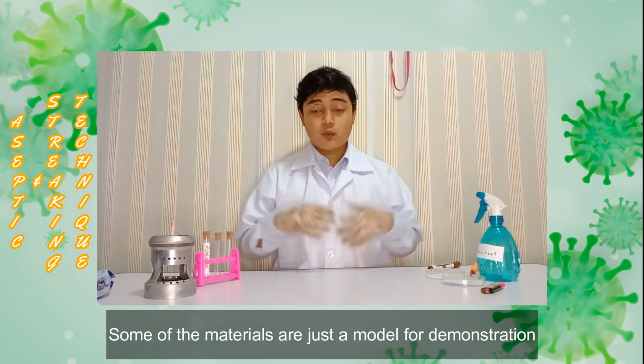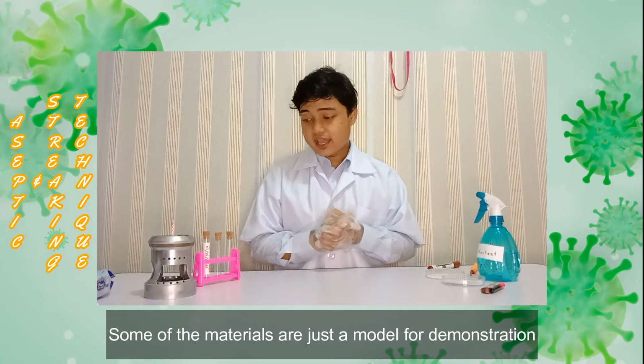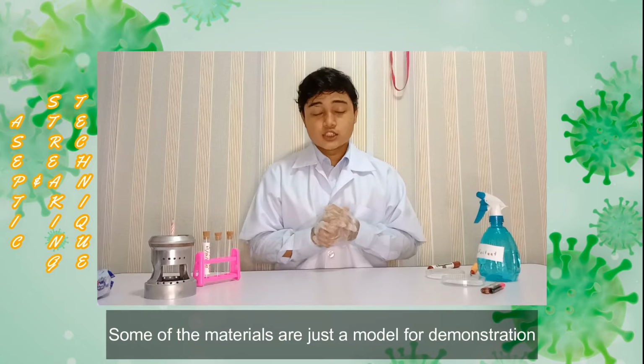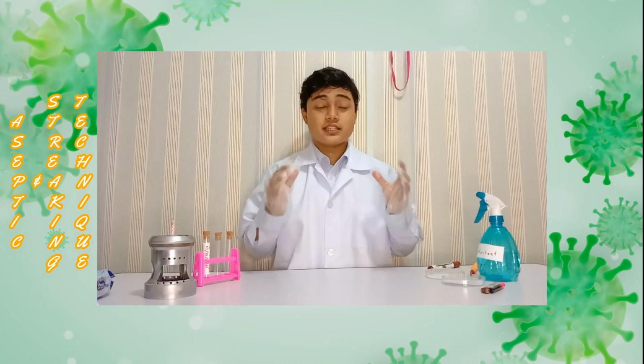First of all, I want to say that some of the apparatus and materials are just models and not real ones. Since I'm not in the lab and I lack apparatus and materials, I use models to represent the real apparatus and materials that I will use in my demonstration.